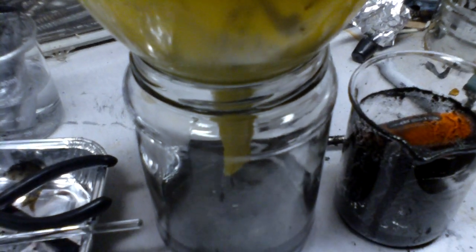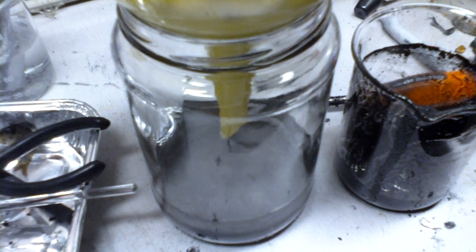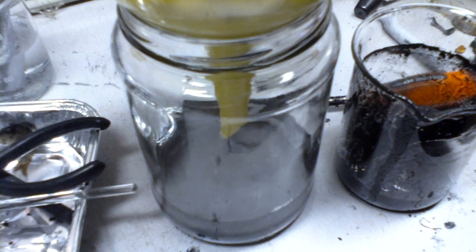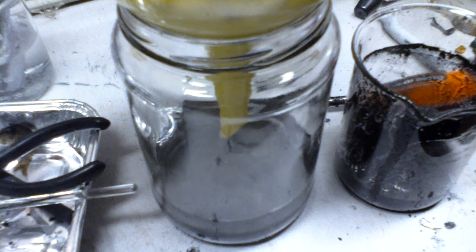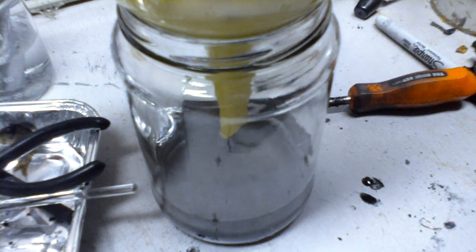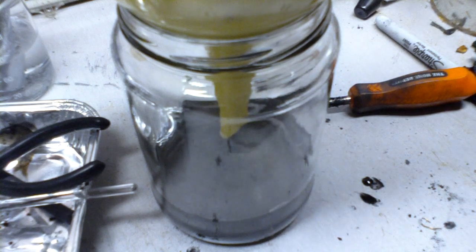But it's starting to turn brown or black from small amounts of manganese that's getting through, and also because I didn't wash the filter from the last filtration I did with another one of those battery cells. So just let that run and collect the paste.